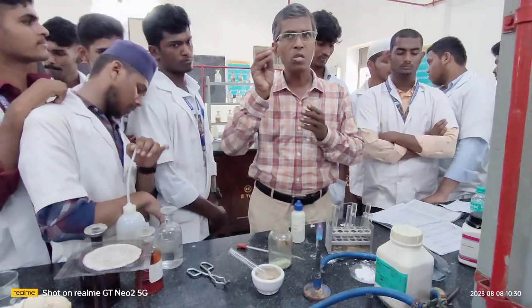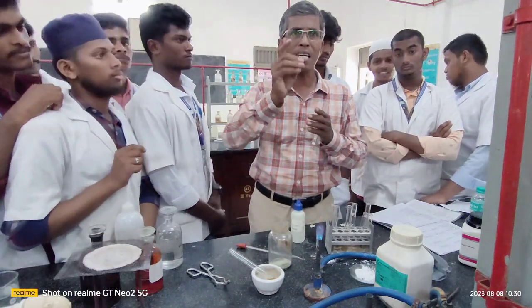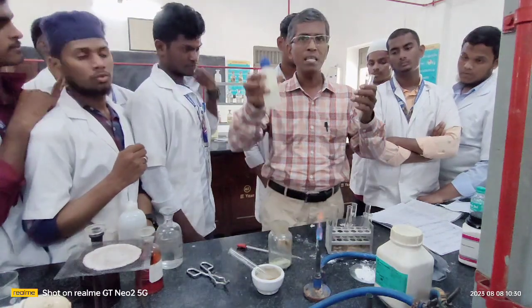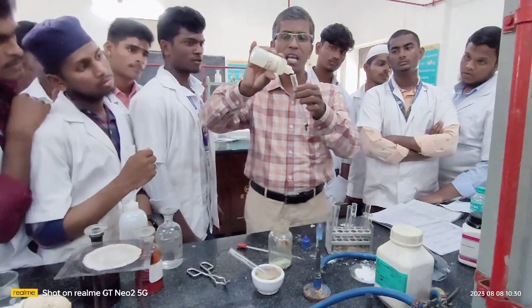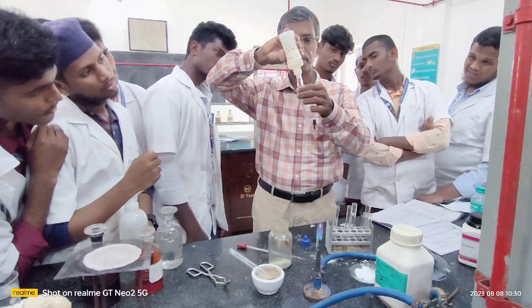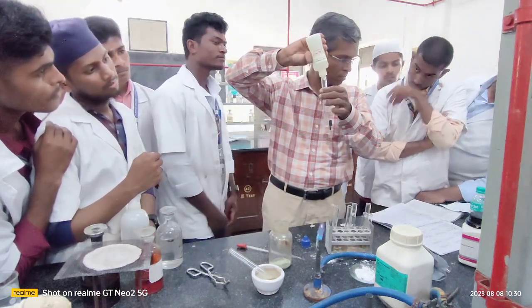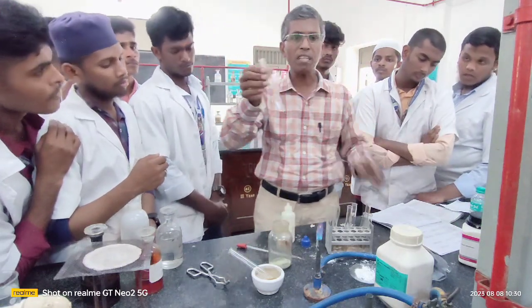Ammoniacal silver nitrate. Use ammonium hydroxide. To this add a little silver nitrate, and then add a little sodium hydroxide, mix it well. The complex, the product you get, is called Tollens reagent. Anyway, at this juncture I am using the commercially available ready-made Tollens reagent. Take extra. Yes, I have taken enough Tollens reagent.